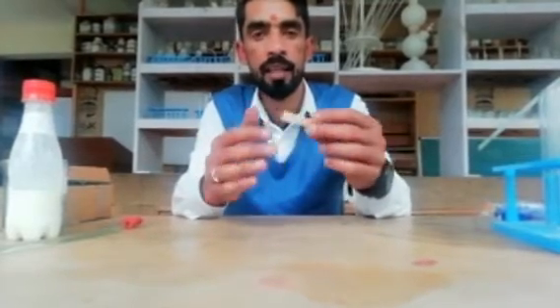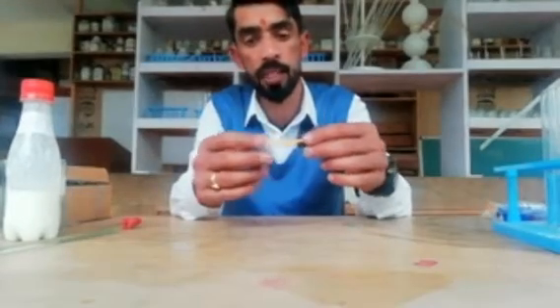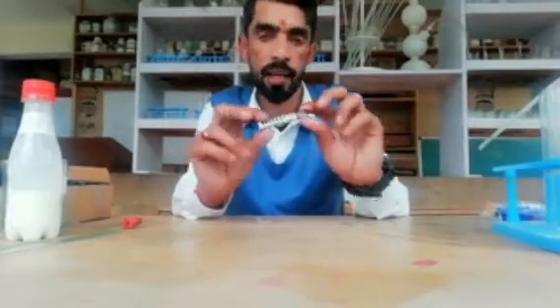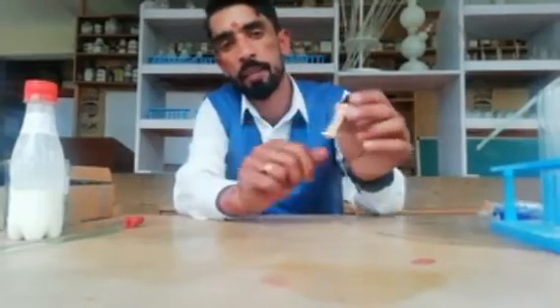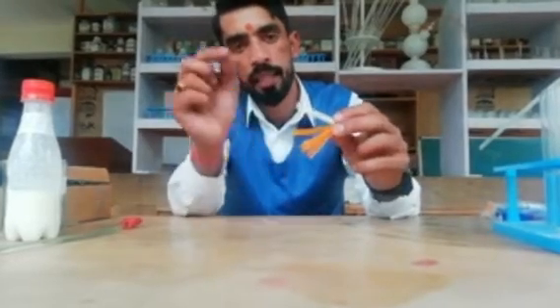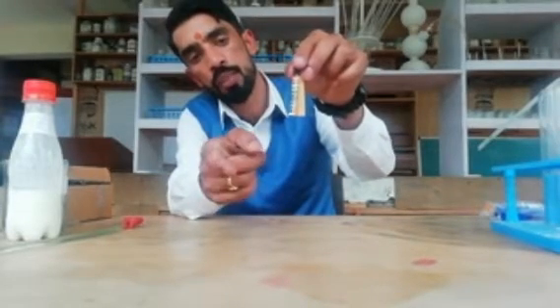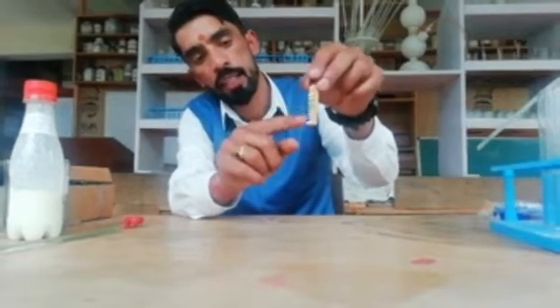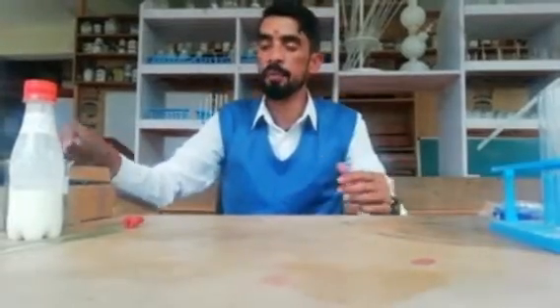As you know, acids are those which have a pH value less than seven, and bases are those which have a pH value greater than seven. The pH scale goes from zero to fourteen. You can see here these values represent some colors. When we put this strip into a solution, it will change to those colors — if the solution is acidic, it will show a color in the acid range, and if basic, it will show a color in the base range.